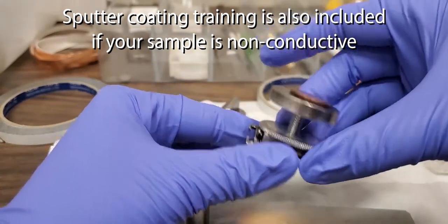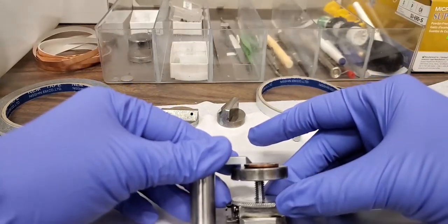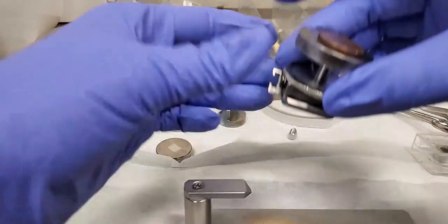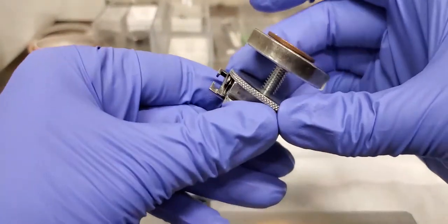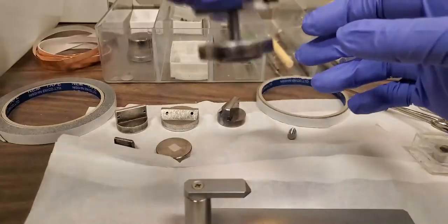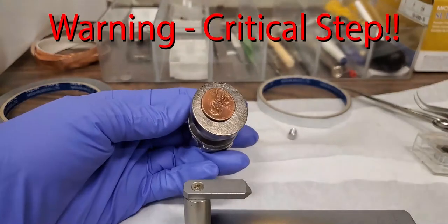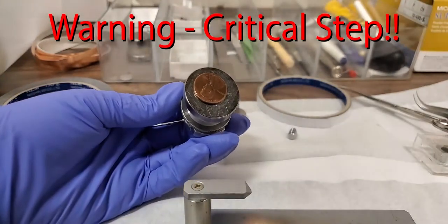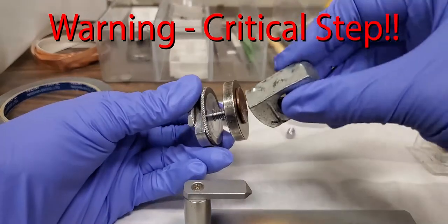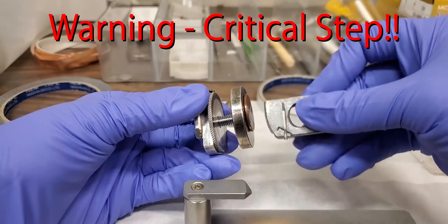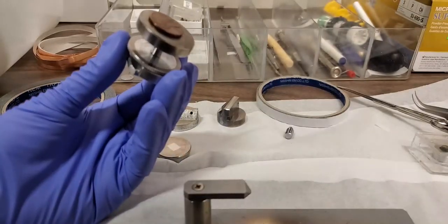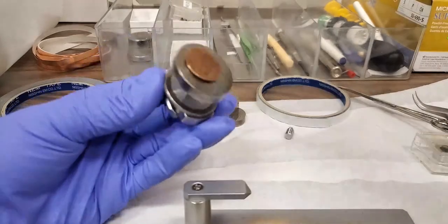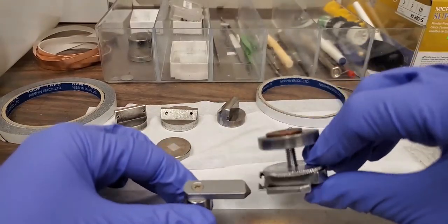And then screw down, just a little bit, until the height looks good. And then we tighten the washer. Very important. You need to use the magnet and check that your sample is not magnetic. So this would be how you would mount the sample.